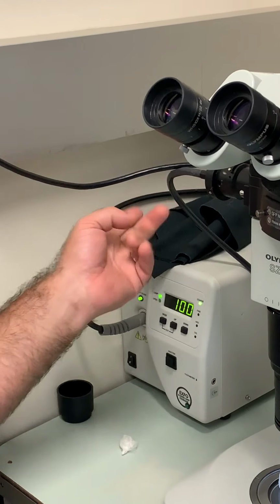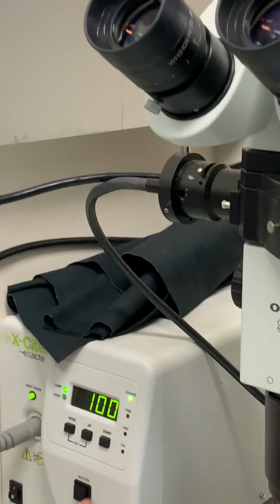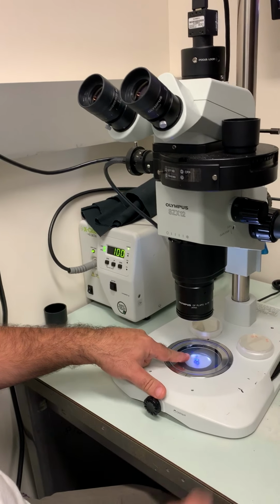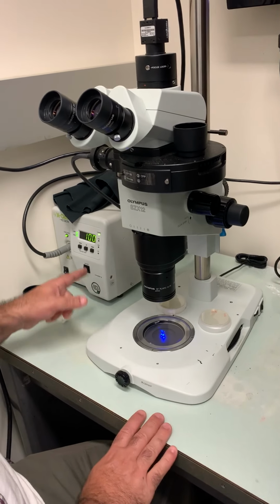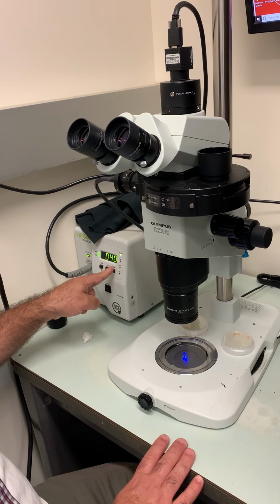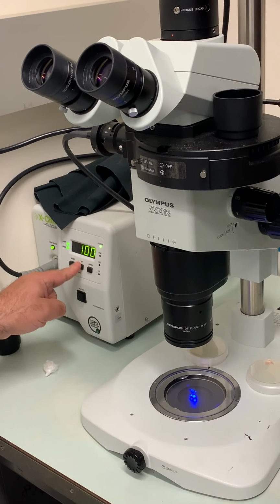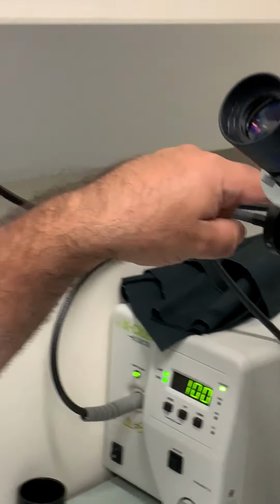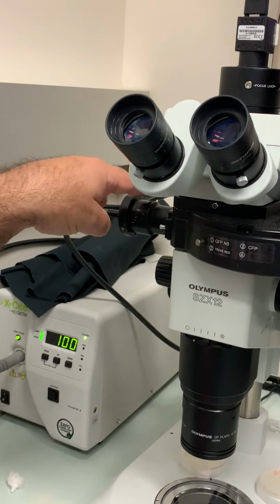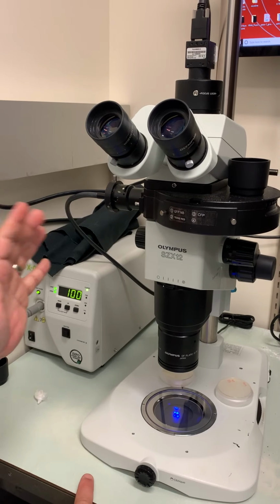Now, the light comes out of the back and goes through this wire. And there is a dial here. I'm just going to turn it on. The shutter is what we use to turn the light on. As you can see, I'm going to turn this down so you can see the light. If I decrease the light, it's going to get dimmer and dimmer. If I increase it, it's going to go up to 100%. Now this dial up here also changes the amount of light that goes through. When it's all the way away from you, it lets very little light through. When it's all the way towards you, that's the maximum amount of light.